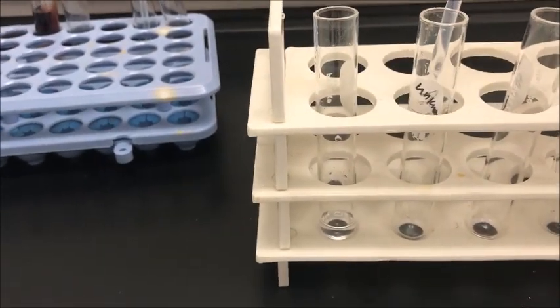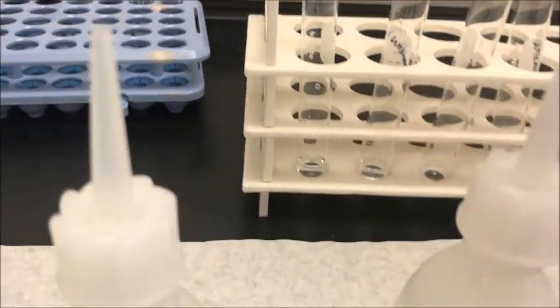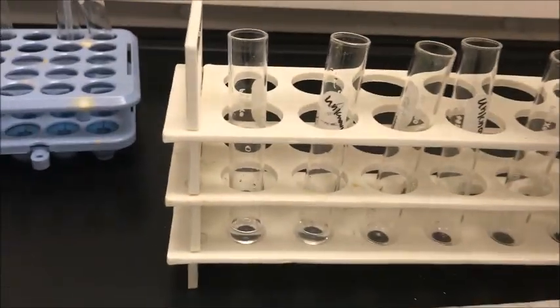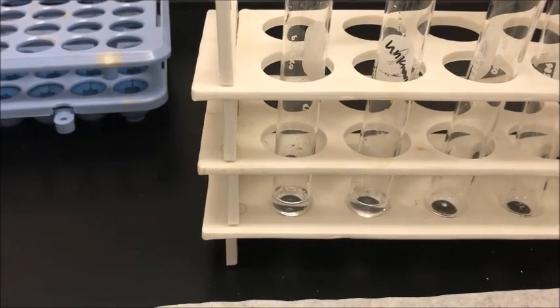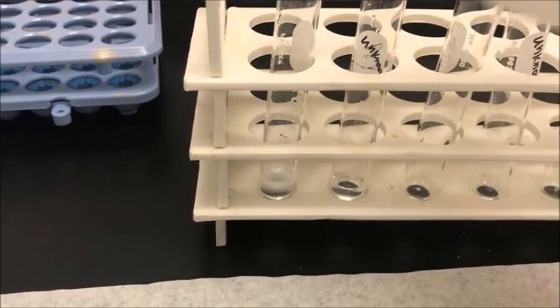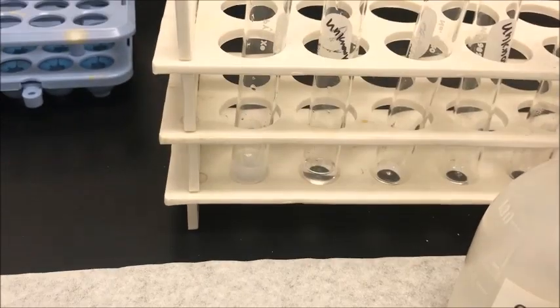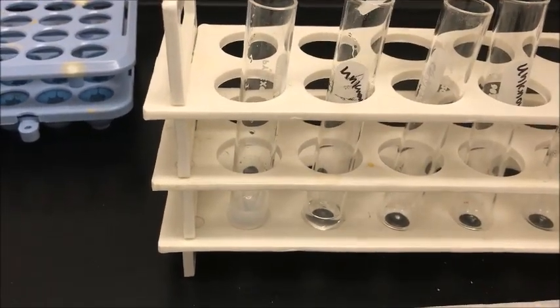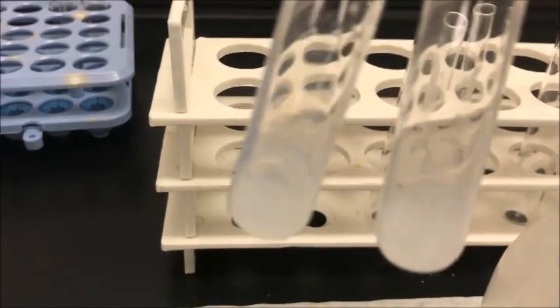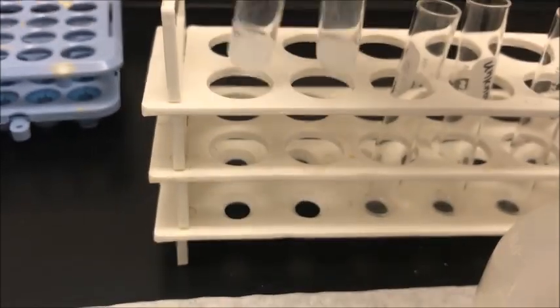To my unknown test tube, add 1 ml. Then add 1 ml of ammonium oxalate solution — that gives a white precipitate if calcium is present. Both my test solution and unknown solution contain calcium ions.